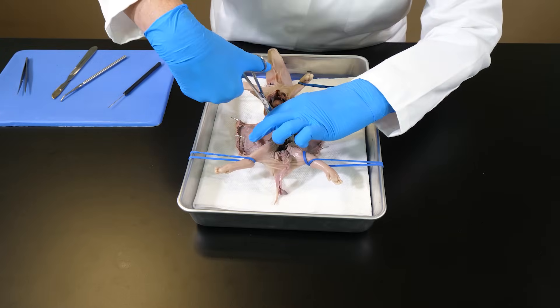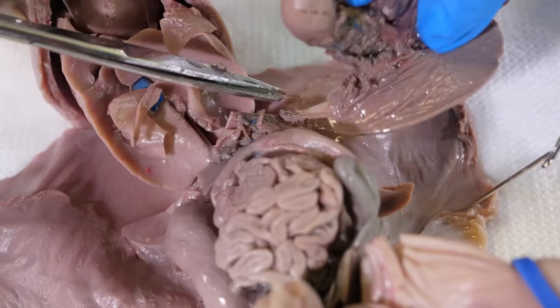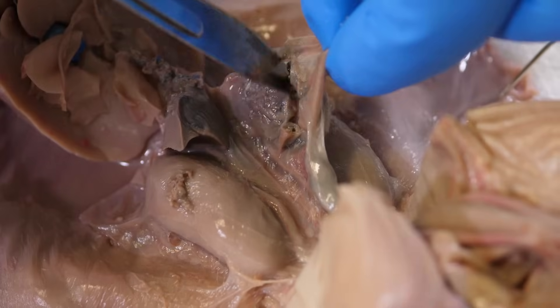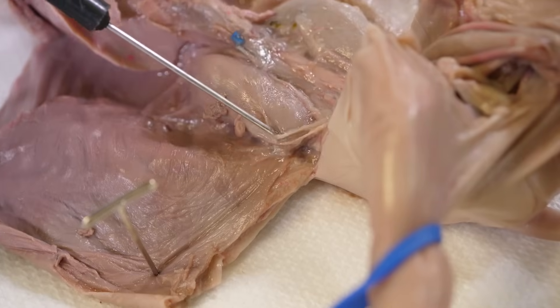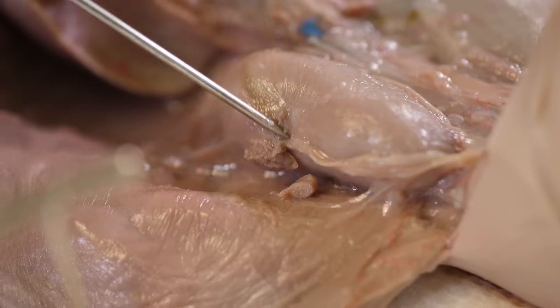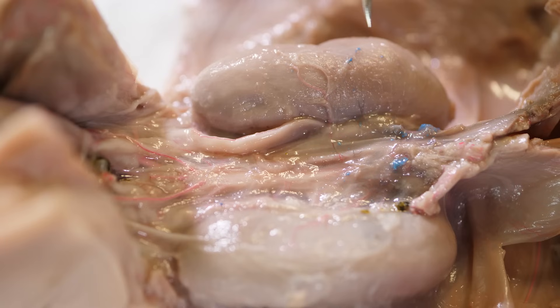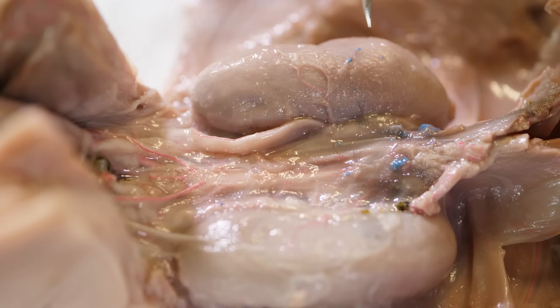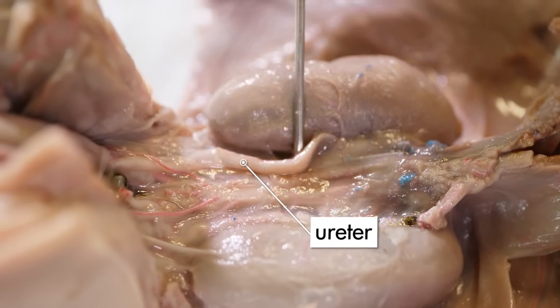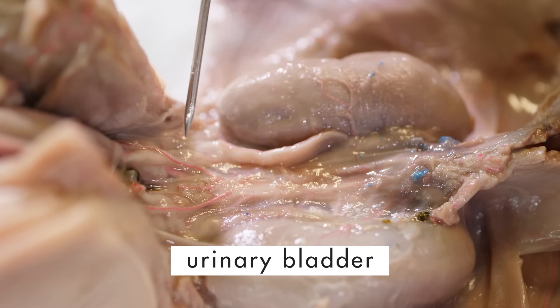To see the organs of the excretory system, we must remove the liver and all the organs attached to the digestive system. With these organs removed, we can see the two kidneys. To get a better view, we need to pick away the membrane surrounding a kidney. The kidneys filter liquid waste out of the blood; this waste is mixed with water to produce urine. Urine passes from the kidneys into the ureters, and after passing through the ureters, the urine flows into the urinary bladder, which is located in this region but is deflated and difficult to see.